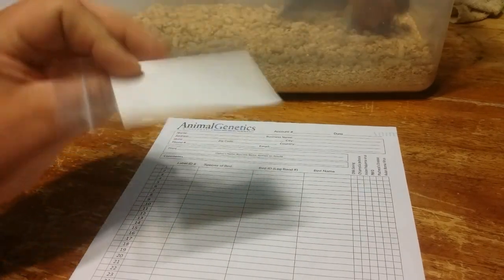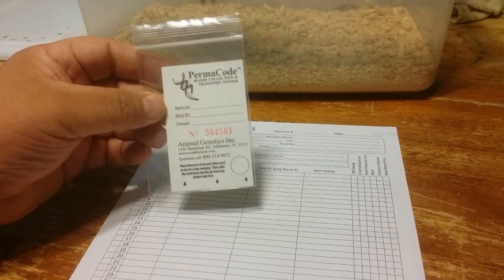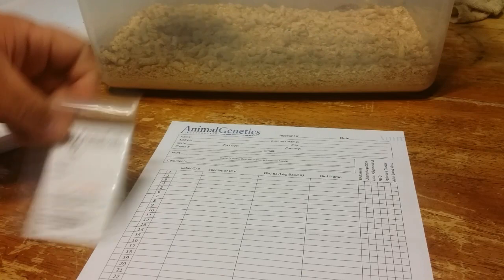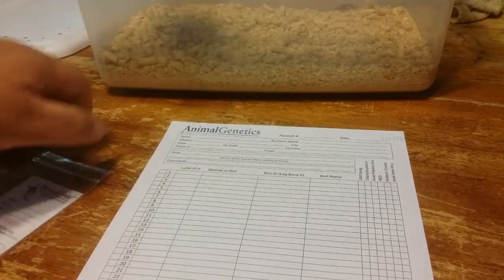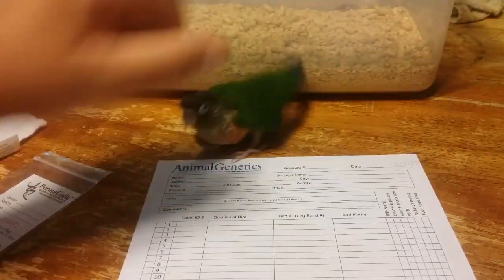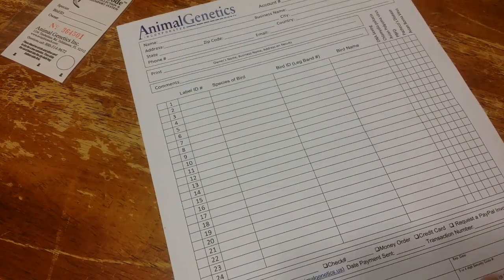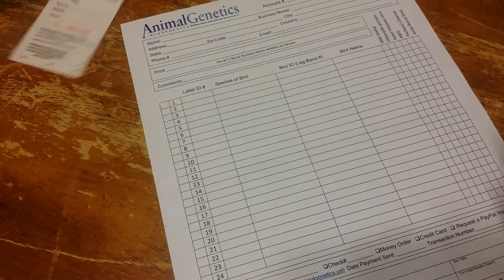It's a piece of special paper that preserves the DNA, and with that you're going to order however many of these that you need and they're going to send a form to fill out. This is absolutely free — there is no cost to order it. For today's video we're just going to focus on the DNA sexing.